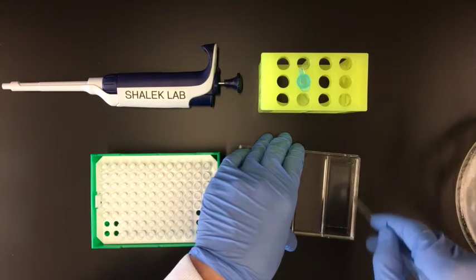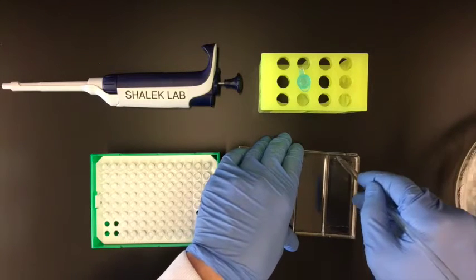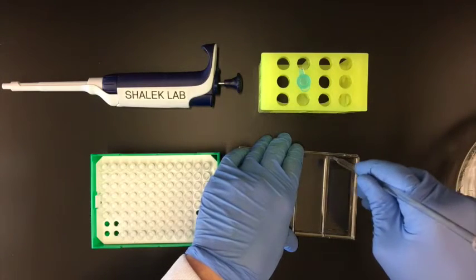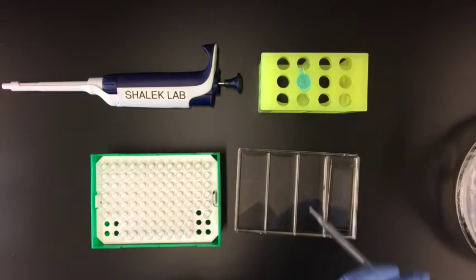So this is a critical part of that. Just making sure that it's completely dry. So now that it's dry, one thing that I'm going to do is move it catty corner within the dish. So you can see what I did.